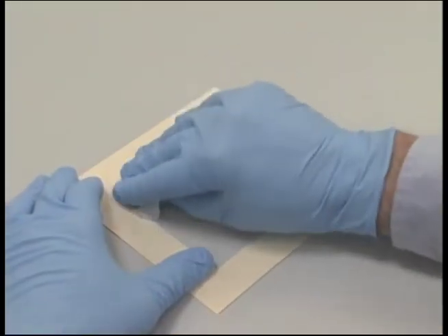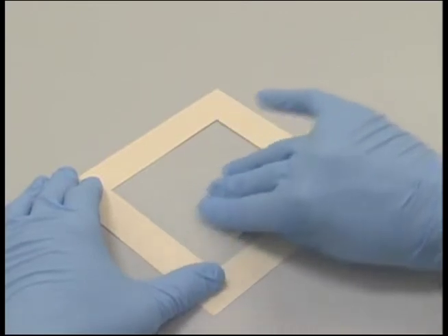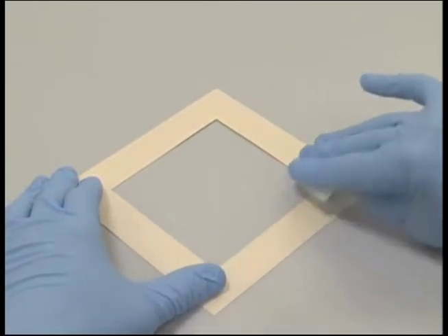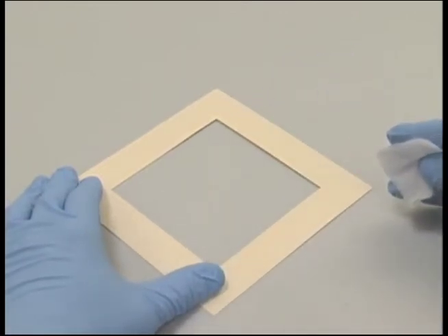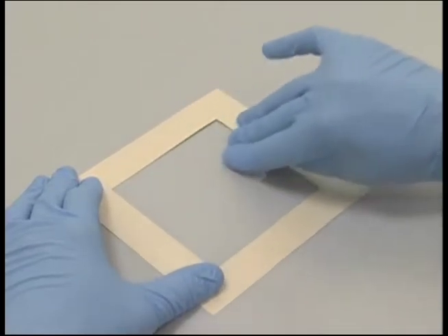Using only one side of the wipe, thoroughly wipe a designated area within the inside of the wipe template using repeated horizontal motions. Wipe the same surface area again using the same side of the wipe.